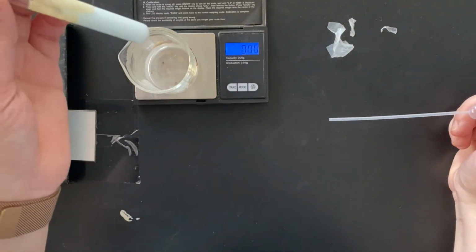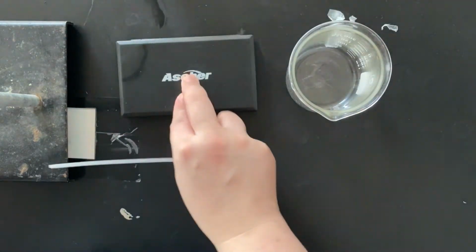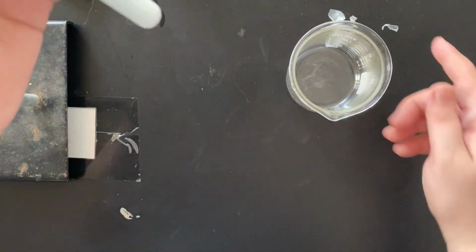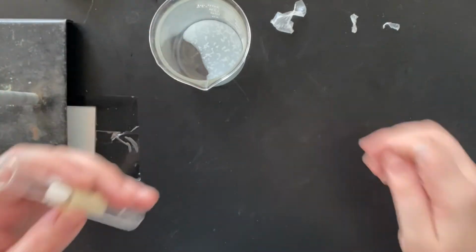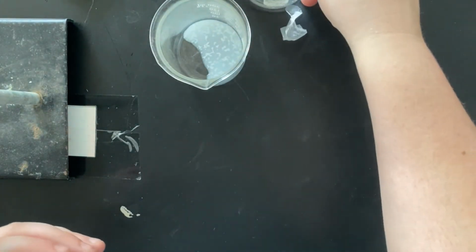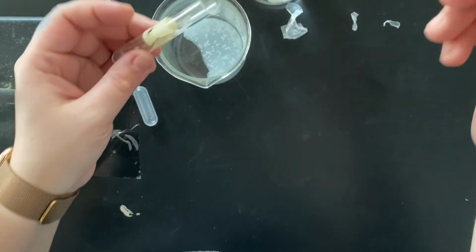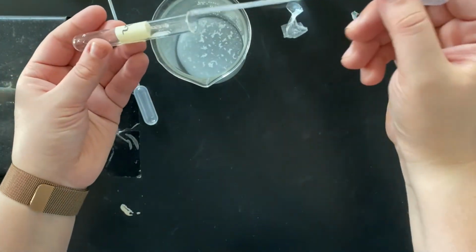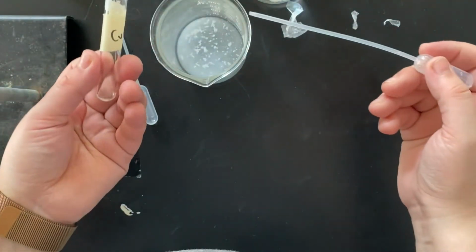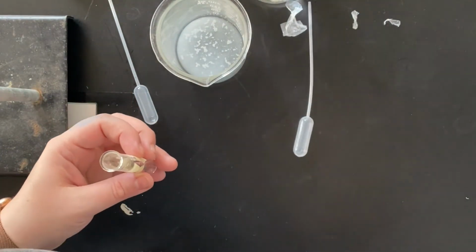Now to rinse this out, these chemicals cannot go down the drain. So you're going to take your waste beaker, let's put this away, turn that off. All of your chemicals in this tube will go into your waste beaker. If you have some stuff on the side of it, that is okay. You'll take your pipette labeled water, soak up some water, and then rinse out your tube. Keep dumping it into your waste until your tube is clean. Then you'll take these tubes, give them back to your lab teacher, make sure everything else is cleaned up, and you are good to go with calculations.